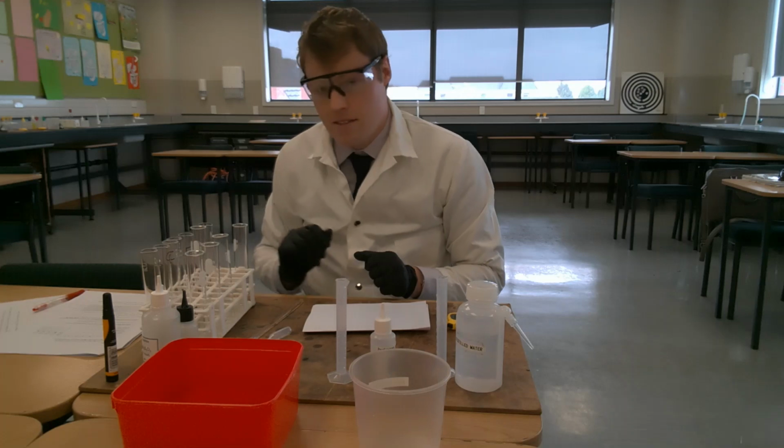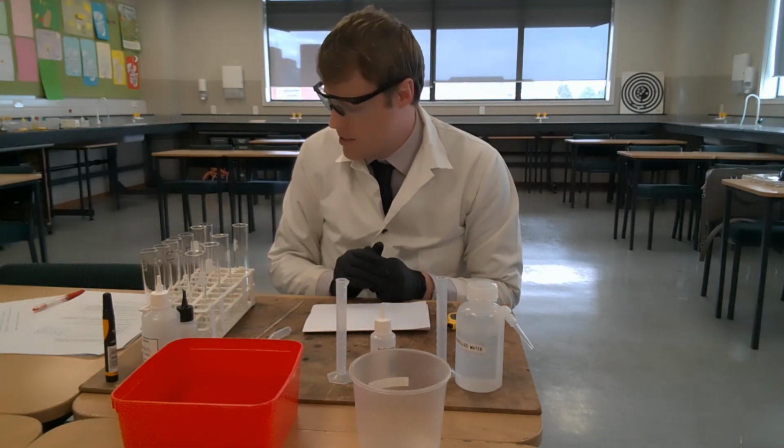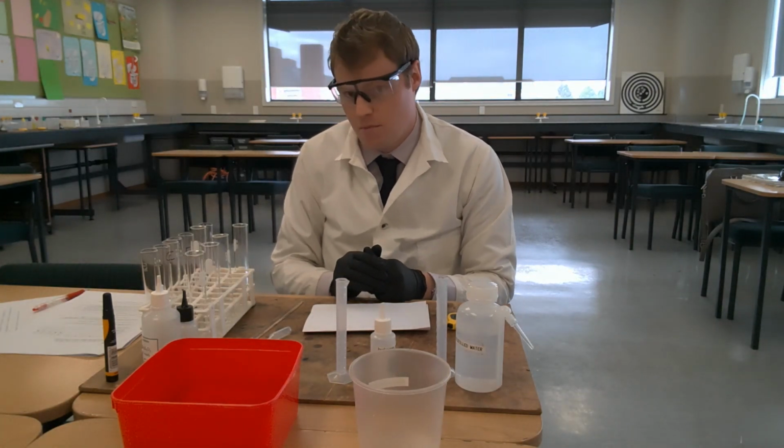So 2 minutes and 22 seconds for tube E to turn blue.